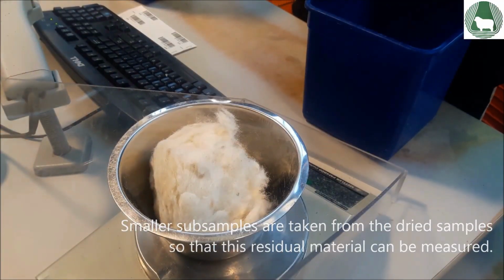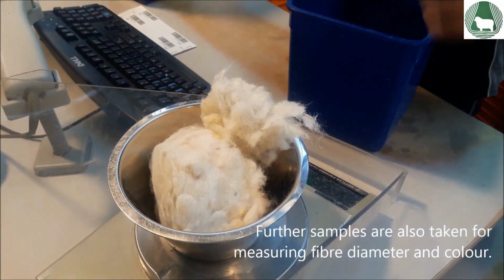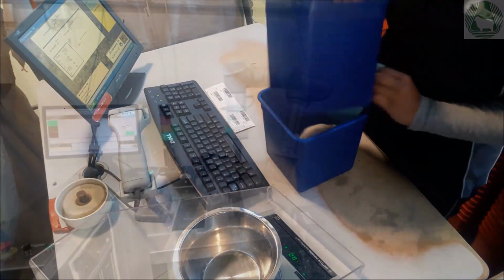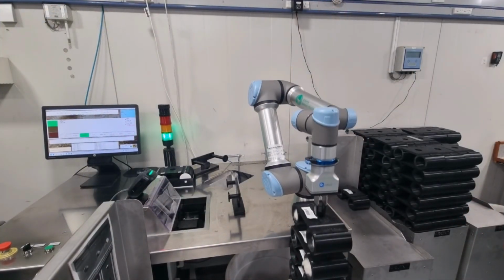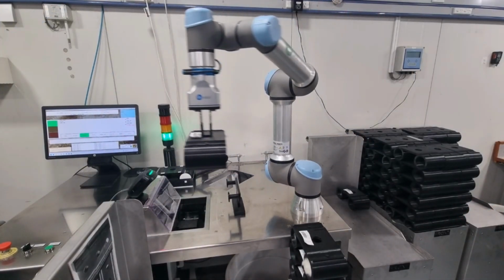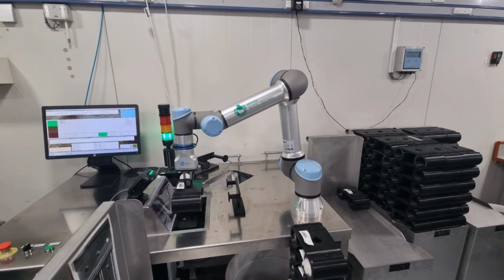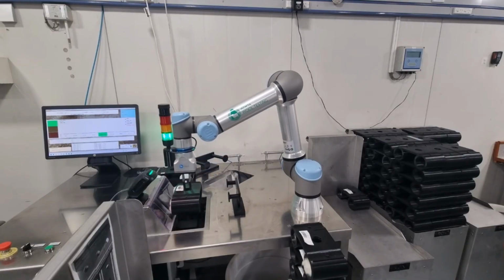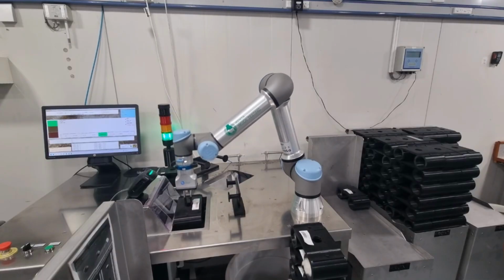Smaller subsamples are taken from the dried samples so that this residual material can be measured. Further samples are also taken for measuring fibre diameter and colour. Wool colour is determined by measuring the amount of red, green and blue light reflected from the clean sample using a spectrophotometer. Three independent measurements are reported. These are simplified as X, Y and Z respectively.